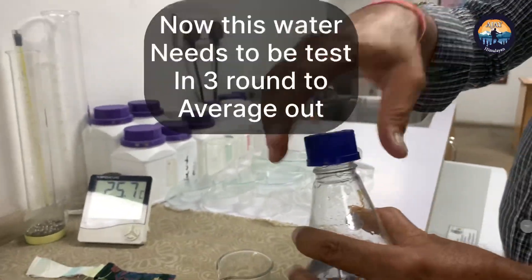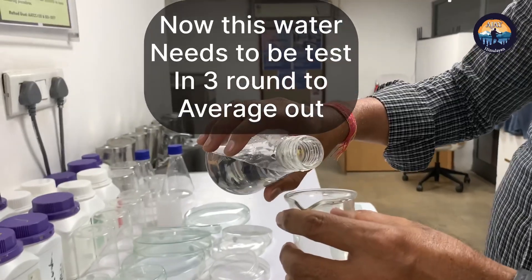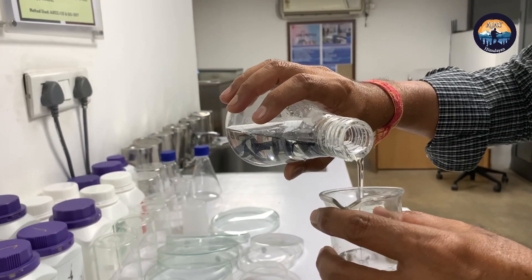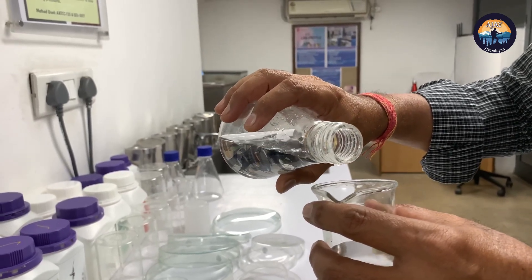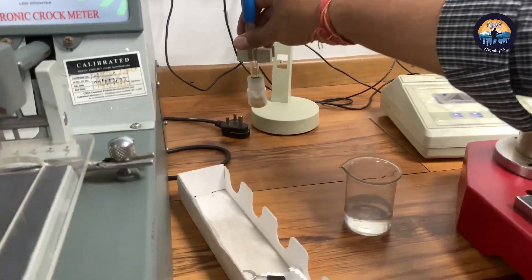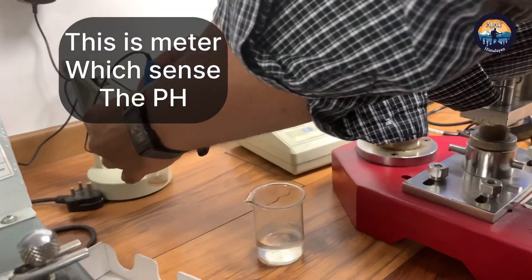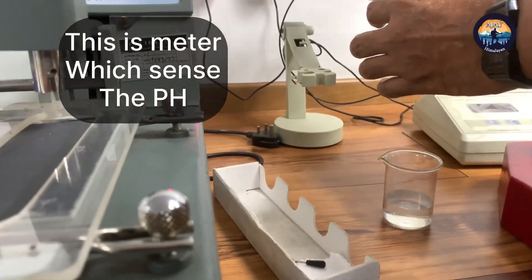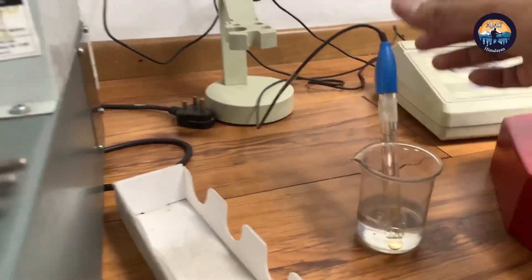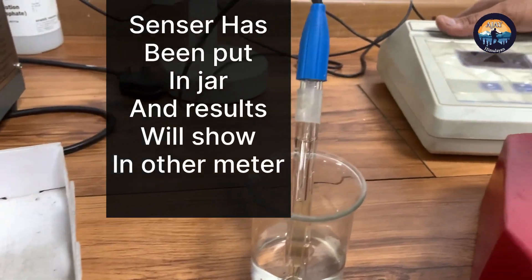Now this 150 ml solution is divided into three parts to test the pH numbers. This is the pH meter — we are inserting the pH meter into the solution jar and the numbers will be reflected on the other meter.